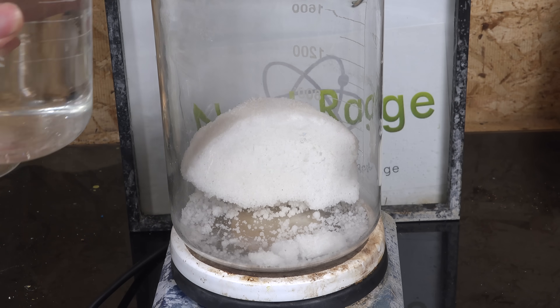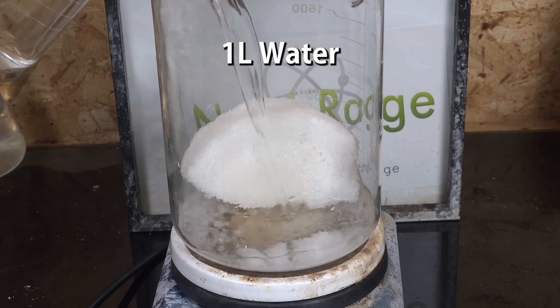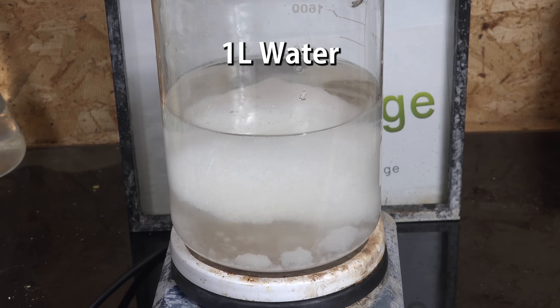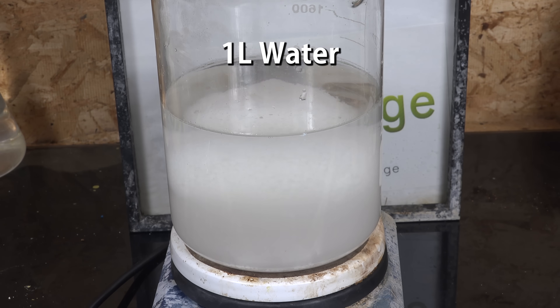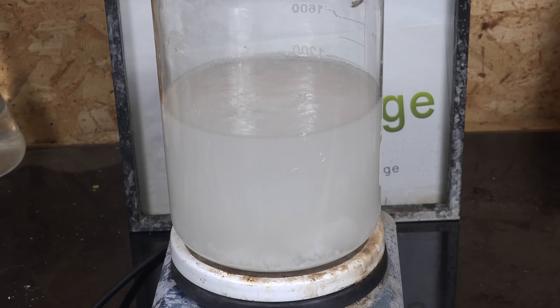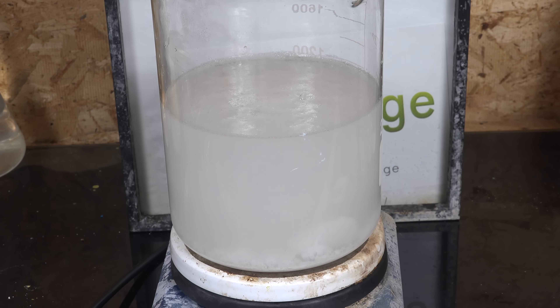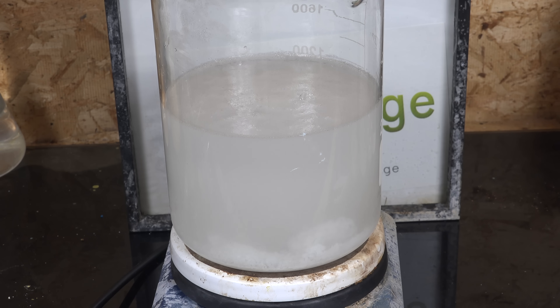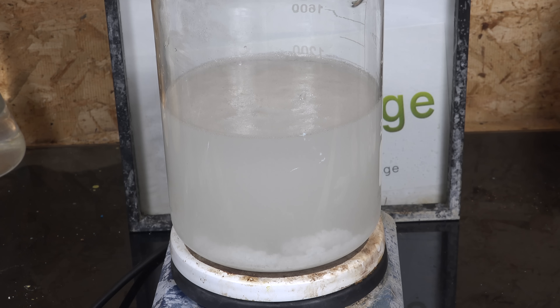Then to this we add one liter of water and stir until dissolved. You can also use other forms of calcium nitrate, as long as it's used in excess compared to oxalic acid, then it will work.